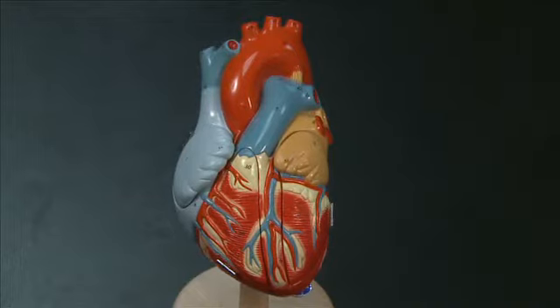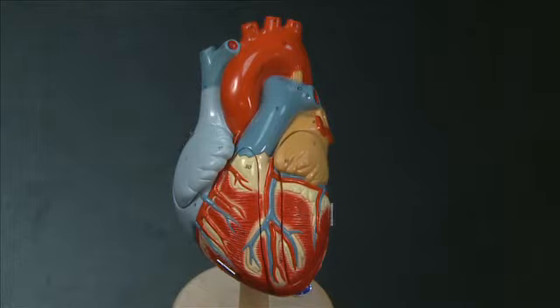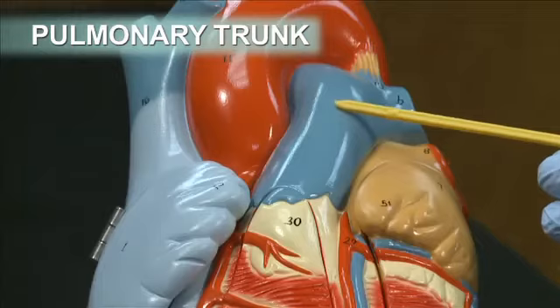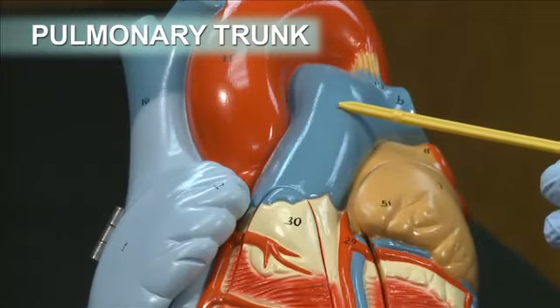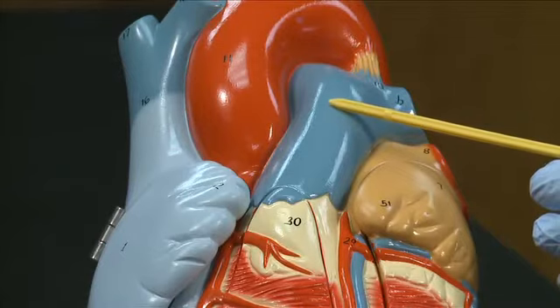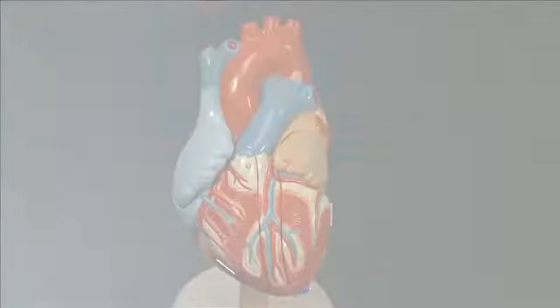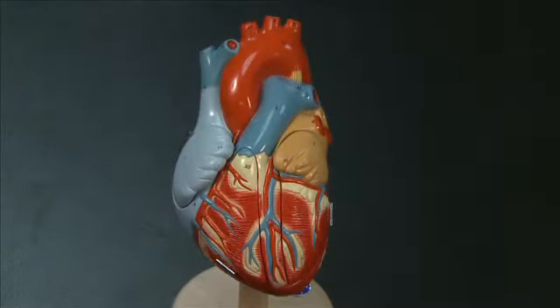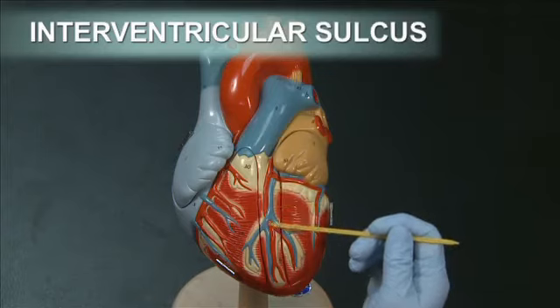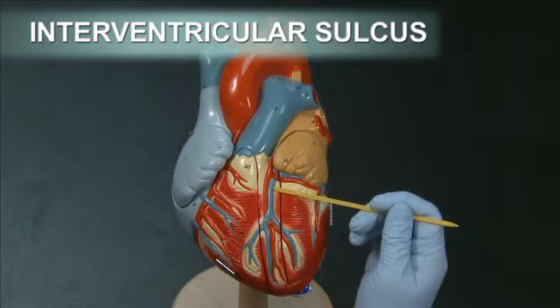The first thing I like to do is to orient the heart. The most obvious structure on the anterior side of the heart is this large vessel, which is the pulmonary trunk. You can see the pulmonary trunk exiting the right ventricle, and it's going to branch into the right and left pulmonary arteries that carry blood to the lungs. Another obvious feature on the anterior face of the heart is the interventricular sulcus, which separates the right and left ventricles and houses some of the coronary blood vessels.